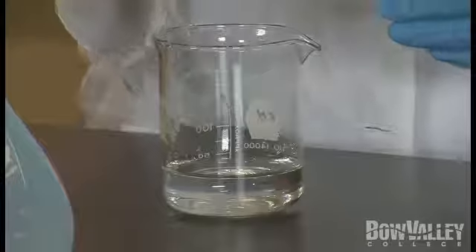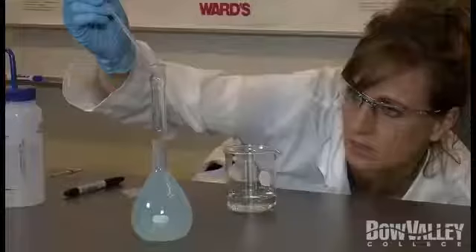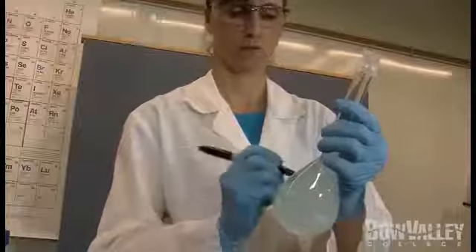Monitor the level and use a disposable pipette for the last few drops. Once again, the bottom of the meniscus should be sitting on top of the line marked on the neck of the flask. Seal the flask with parafilm and gently invert to mix thoroughly. Label your flask — your diluted solution is now ready for use.